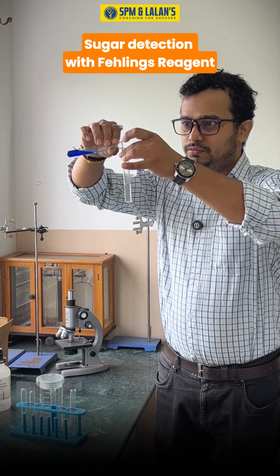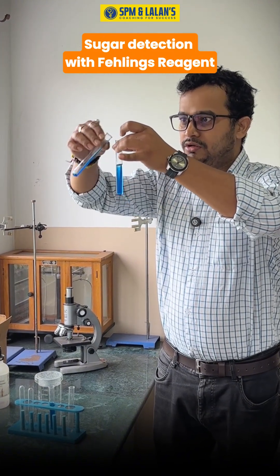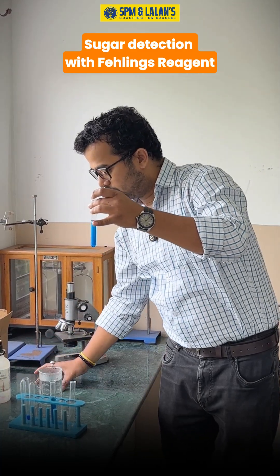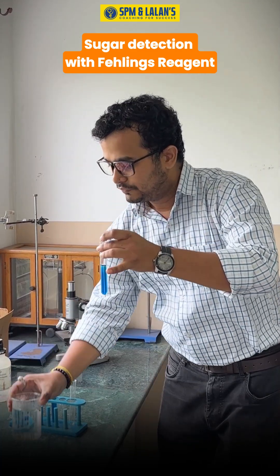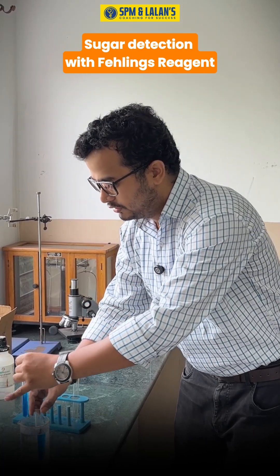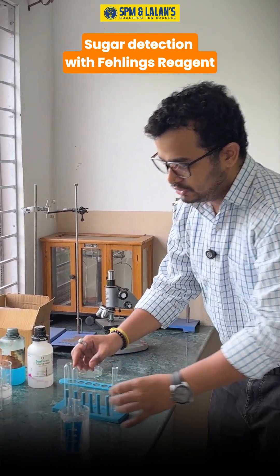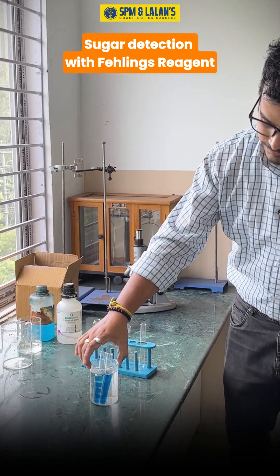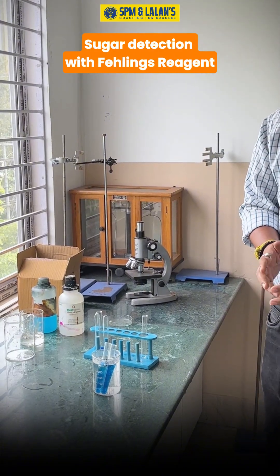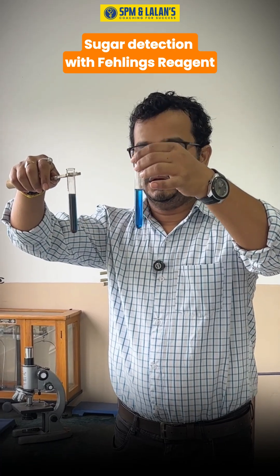One test tube contains sugar and the other does not contain sugar. I'll keep both test tubes in hot water for some time to check which solution contains sugar and which does not. Let's wait for a few minutes and see if there is a difference in the color.